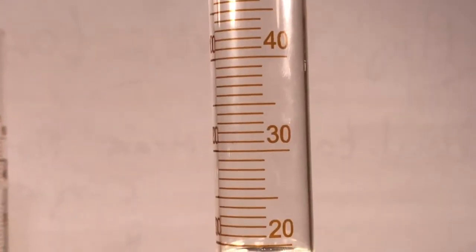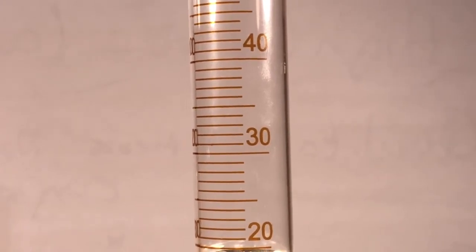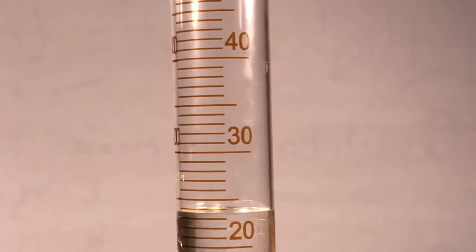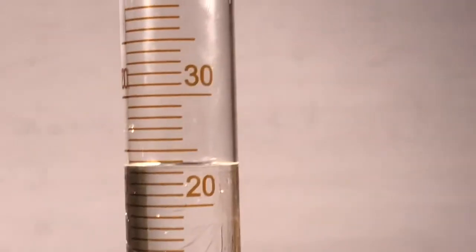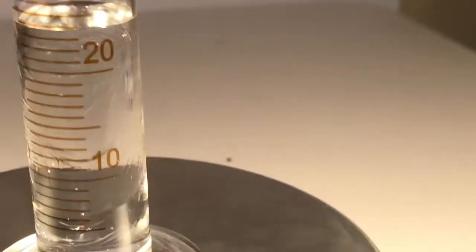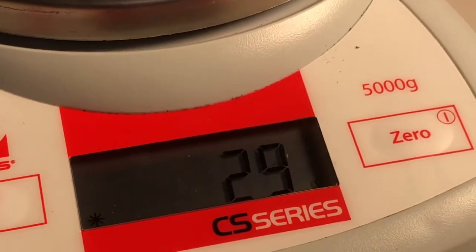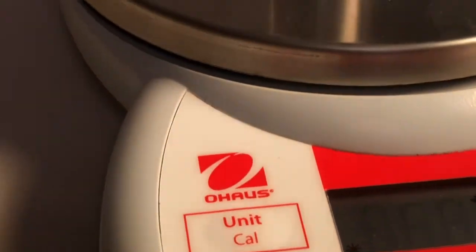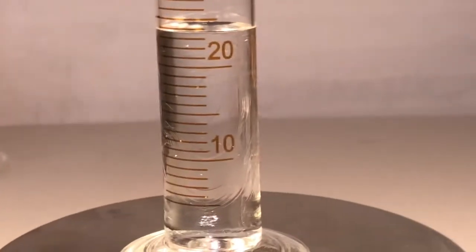Is that 4, right? All right, you guys, here comes 5. A beautiful clear liquid. Liquid number 2. What's that going to be? Read the bottom of that fat white line. And mass number 5 for the y-axis is, got it? Here comes 6.